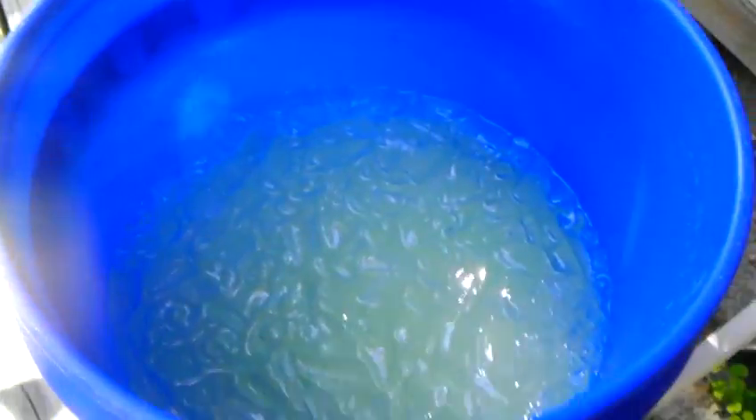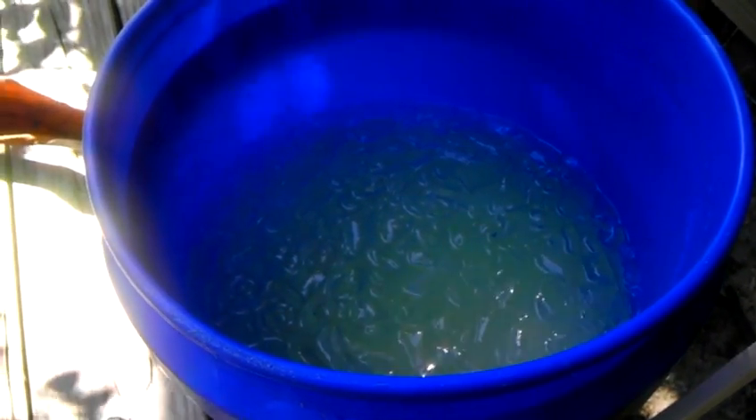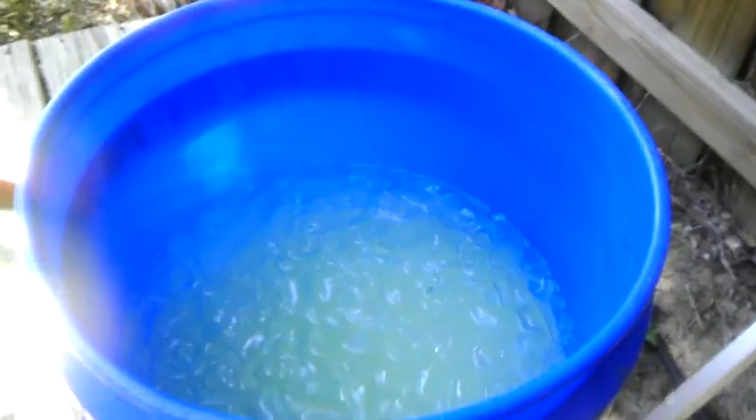This is still cooling, it's almost done. You can see that the color's changed and it's starting to get milkier and settle. We're going to leave this for a couple hours. Some of you might be worried about it — this is what it looks like after only about 20 minutes. It got really cloudy and all that ice melted. It's starting to warm up; I might need some more ice, but it's pretty cool out today.